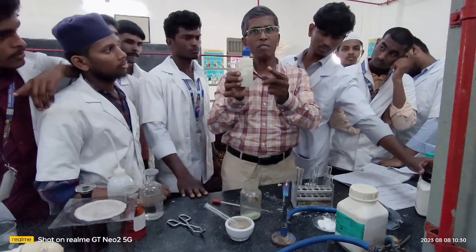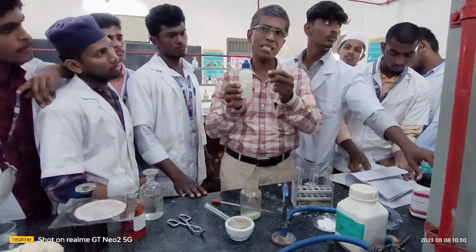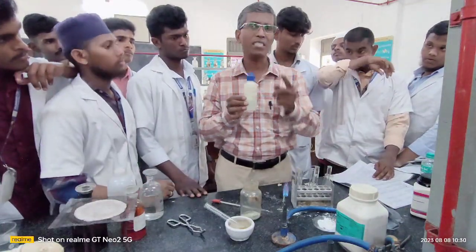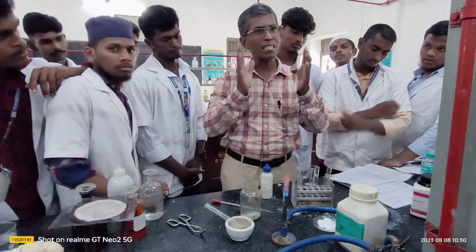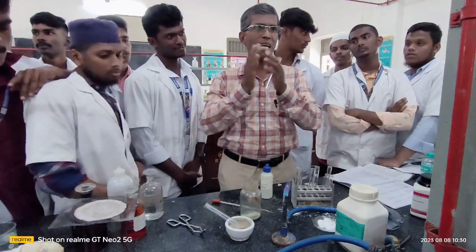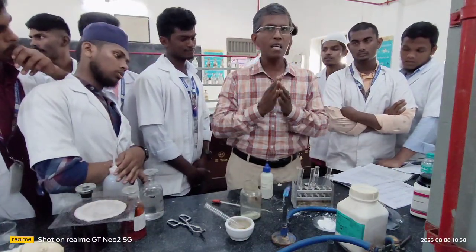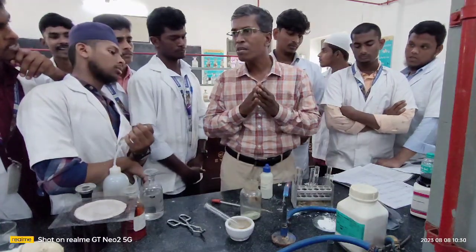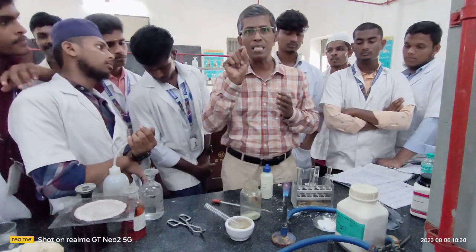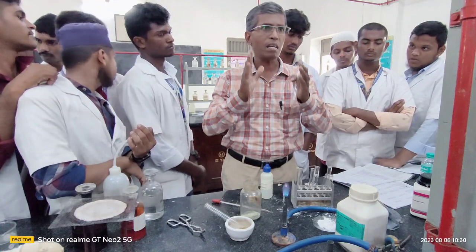Normally, the Tollens reagent you have to prepare in the laboratory. How to prepare the Tollens reagent? Anyway, I'll ask the laboratory assistant to keep the prepared Tollens reagent. Now try to understand what Tollens reagent is at this juncture. The Tollens reagent is nothing but ammoniacal silver nitrate, wherein you are mixing ammonium hydroxide plus silver nitrate plus a little sodium hydroxide. A combination of all these three is collectively called Tollens reagent. Therefore, Tollens reagent is otherwise called ammoniacal silver nitrate.